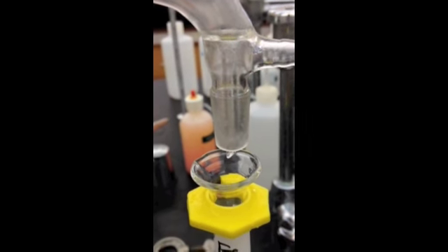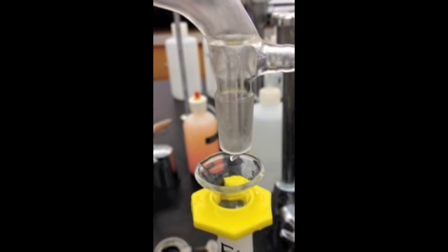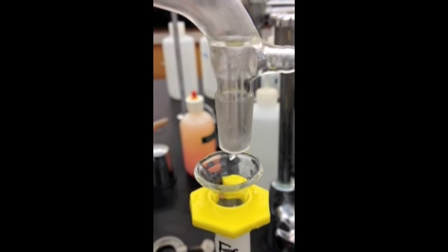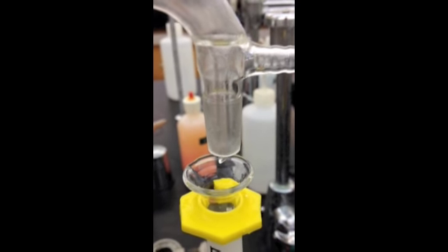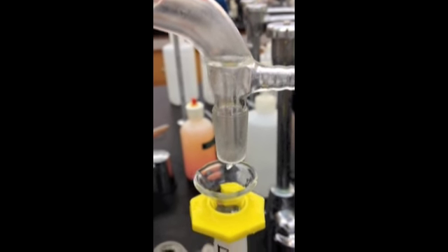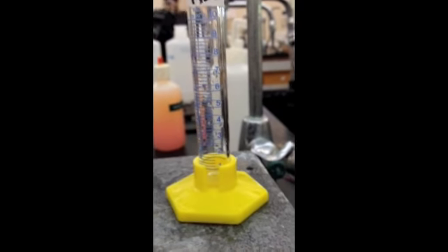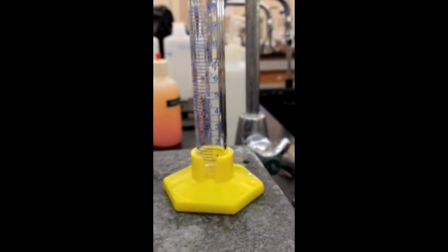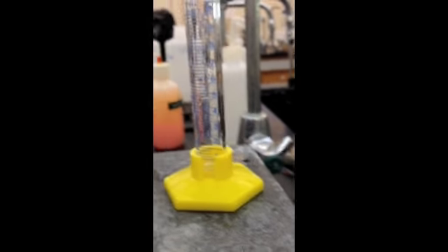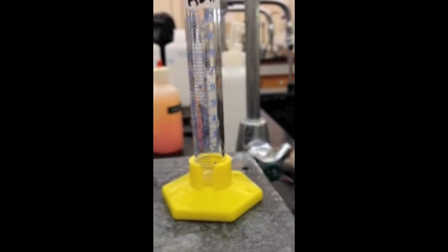Now, as you see, you're about to get little drops of distillate. You want to adjust the rate of heating so that you get about one drop per second. This is much too slow right now. When your graduated cylinder reaches the appropriate milliliter mark, you should mark the temperature that it is at. Right now I'm at about a half a milliliter, so I'm going to go up to the temperature, and the temperature is at about 55 degrees Celsius.